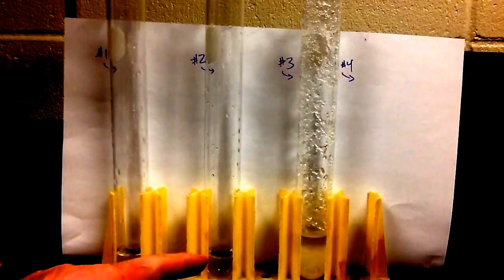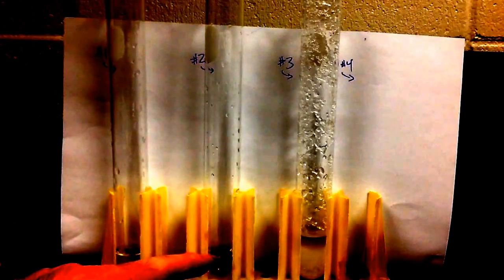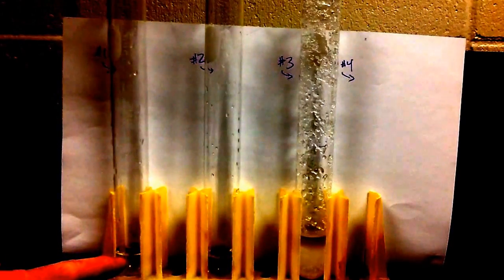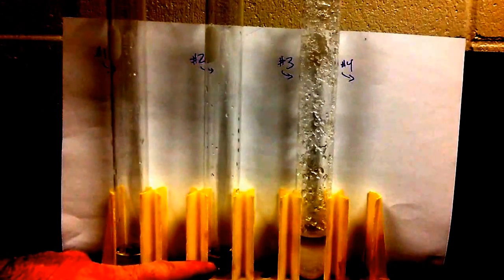Well, if in the second step, if all the chemical dissolved in here, that must mean that the first solution was unsaturated, because we were able to dissolve more.